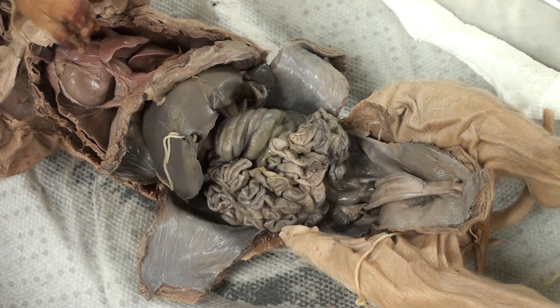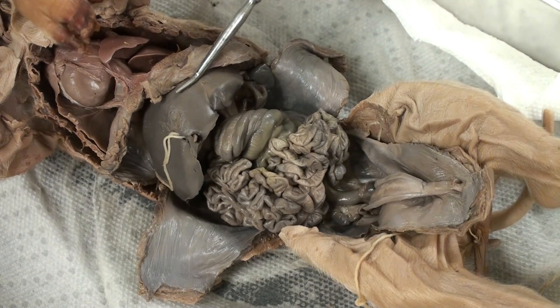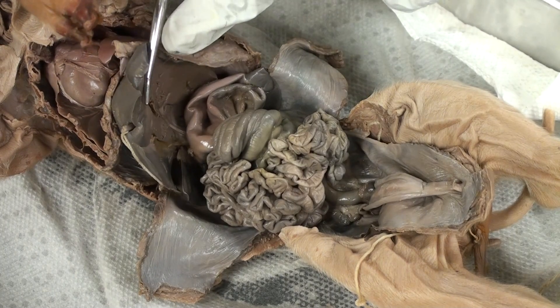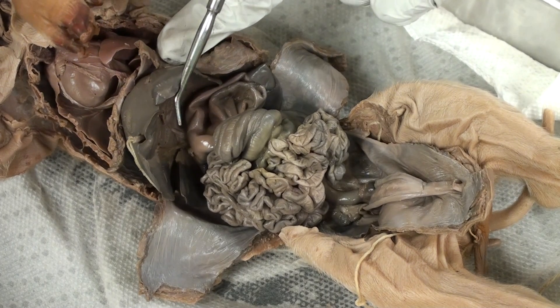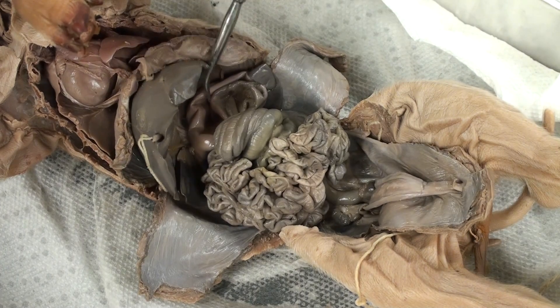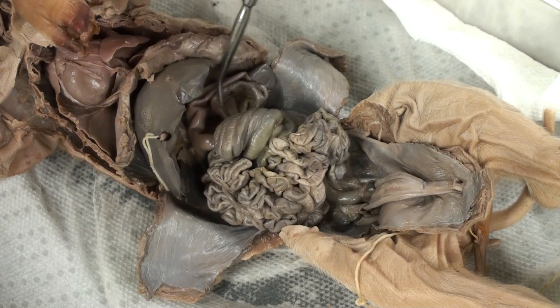For a quick review: located right here is the liver. Located beneath the liver, the pouch-like structure over here is the gallbladder. Located here, the balloon-like structure beneath the liver is the stomach.